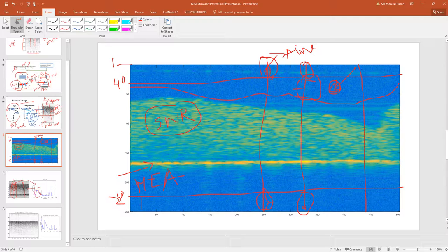Also, you can do the same for an image where there is no particle streak. You can do it either way. So this is the better method of subtracting the noise. I can call this method subtraction from each line. We are taking care of each individual line differently, not like the previous method where we generated the depth profile for all the lines as one, and subtracted the same reference arm depth profile from all the lines. But here we are subtracting a different amount of noise for different lines. So that's definitely a better method than the previous one.